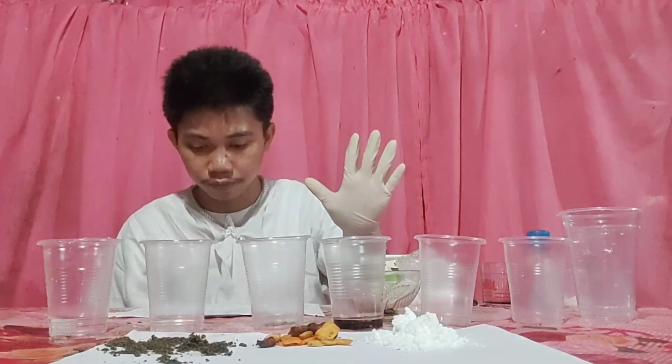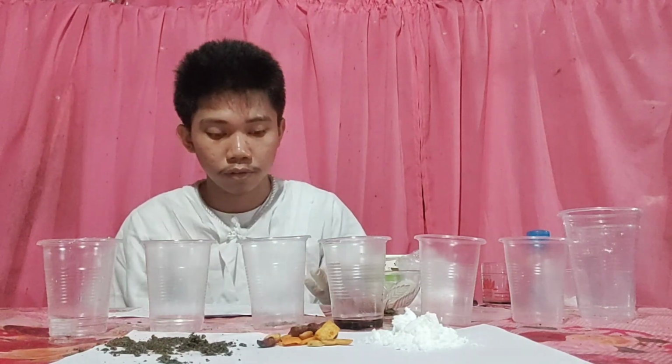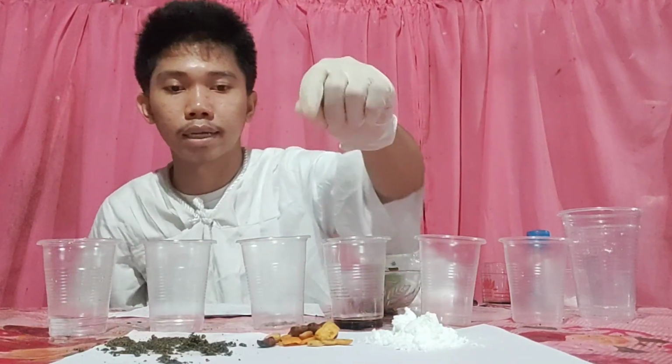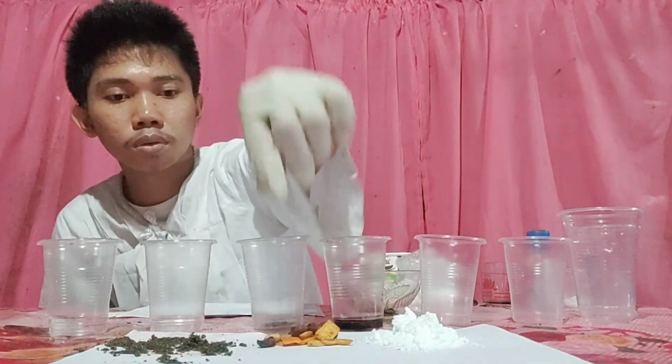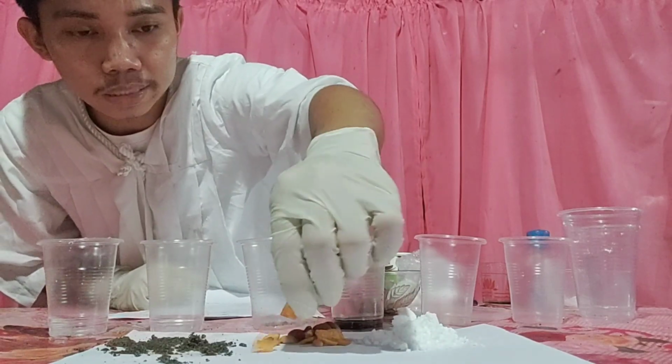And fifth, three varieties of chips. The method for separation is hand picking. So we will just use our hands. So we will separate.